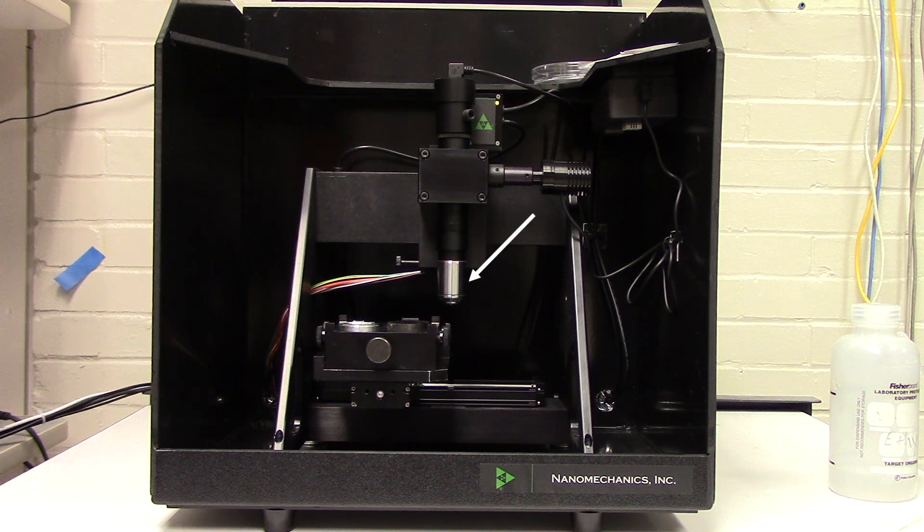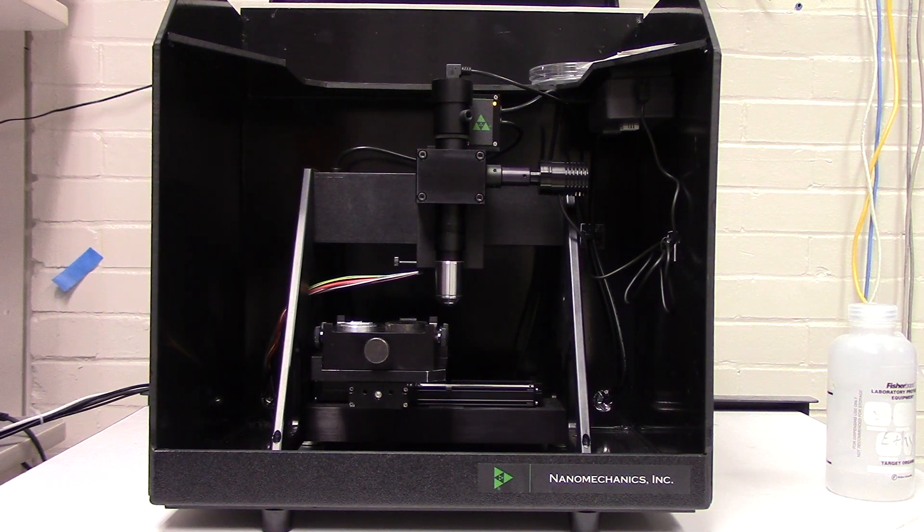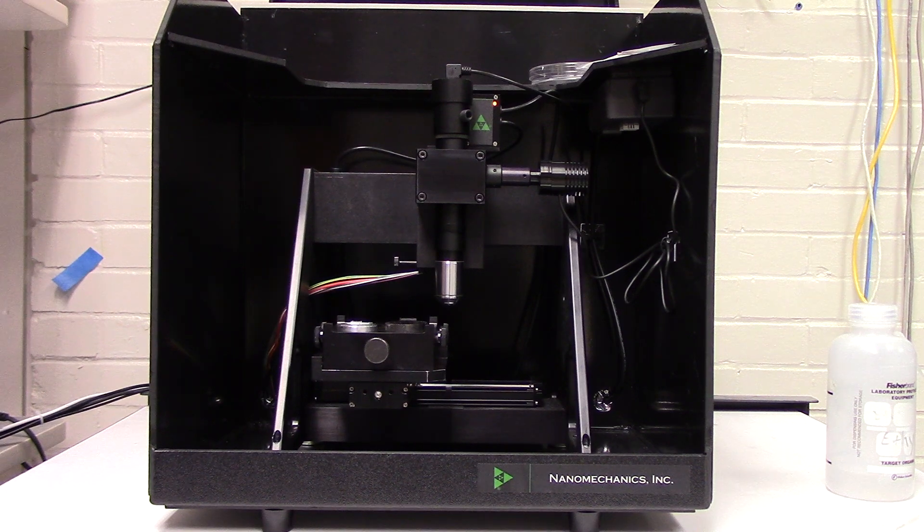Finally, we have the microscope that will allow us to look at our target surface and make sure that we're performing the correct tests. Now that that's out of the way, let me show you a couple ways to prepare your sample for usage in the Nano Indenter.